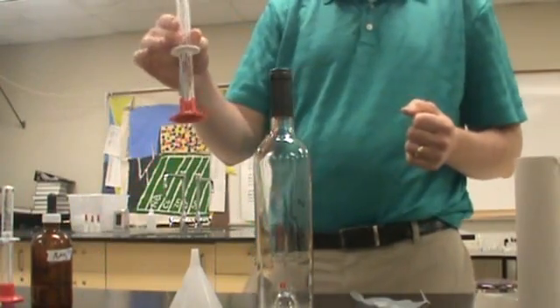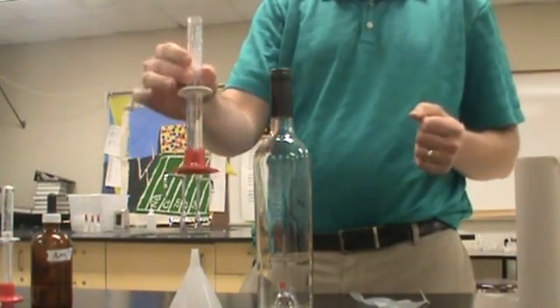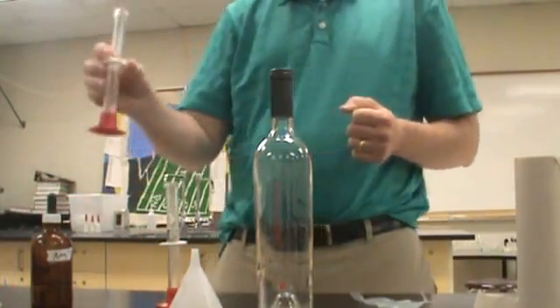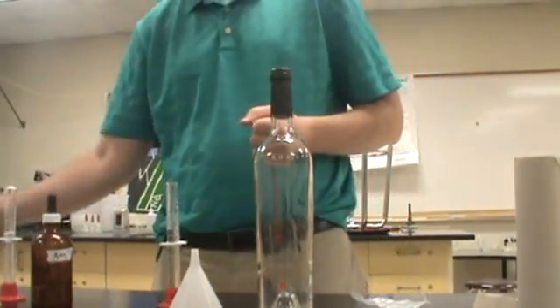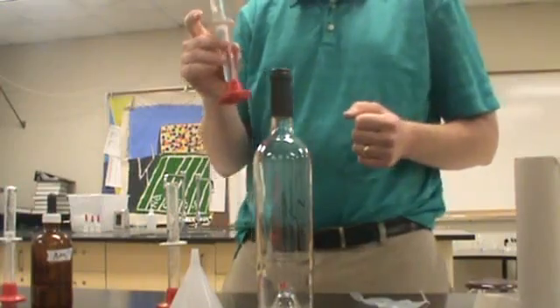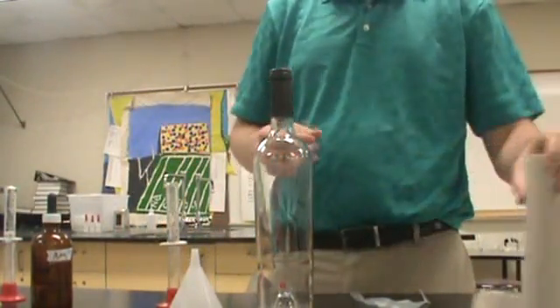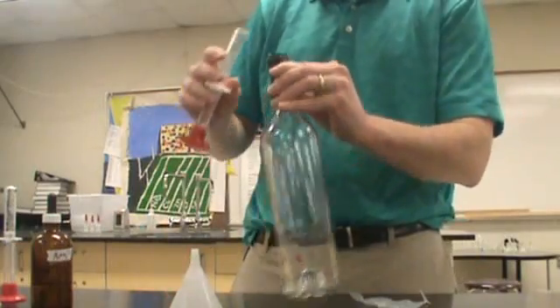Okay, and I'm going to add to it three things. The first thing I'm going to add is a mixture of silver nitrate and ammonium nitrate. Then I'm going to add some dextrose. And then lastly, I'm going to put some sodium hydroxide in there. This is actually potassium hydroxide. And then I'm going to cover it, and I'm going to show you the technique we've been using to get this to work really well.